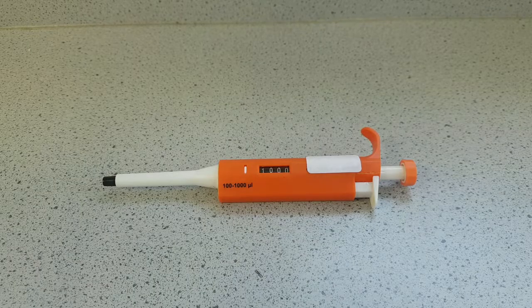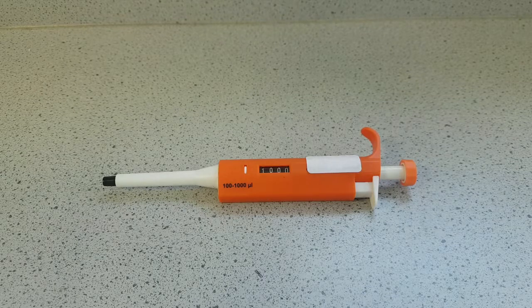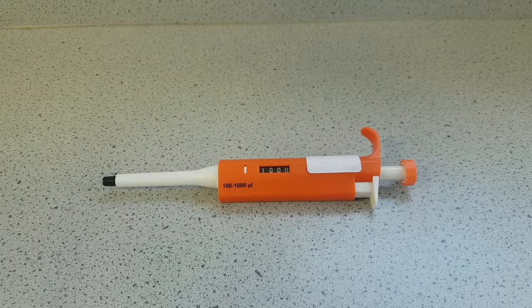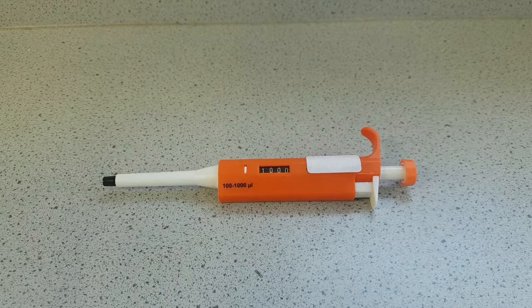In this video I'm going to show you how to use an auto pipette. There are many different manufacturers and types of auto pipette with different capacities, but the theory on how to use them is pretty much the same.